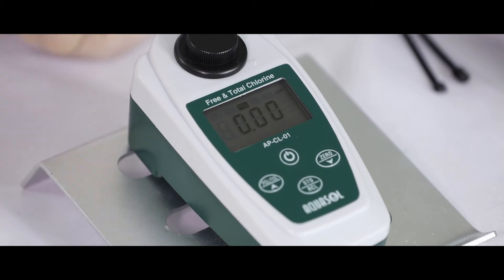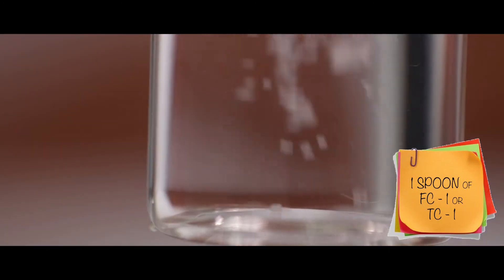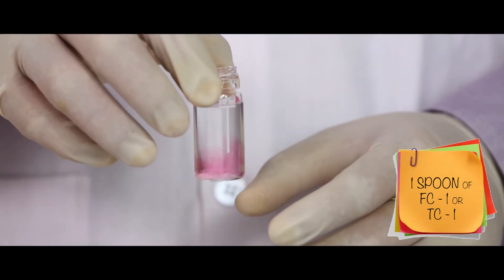Once the display shows 0.00, take the sample bottle out and add one spoonful of FC1 or TC1 reagent in the bottle.